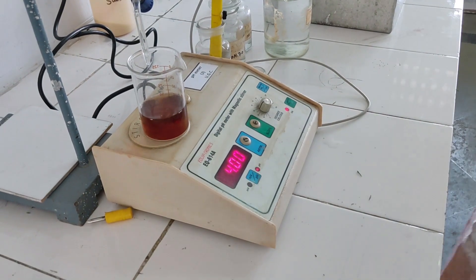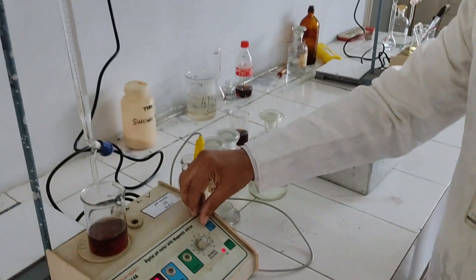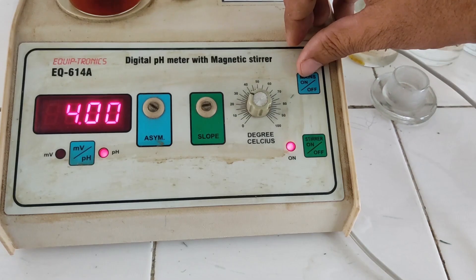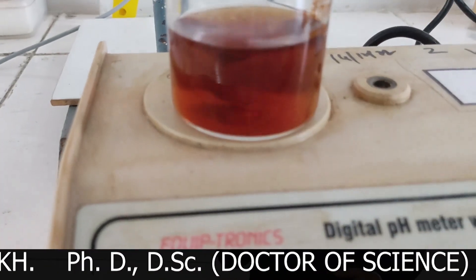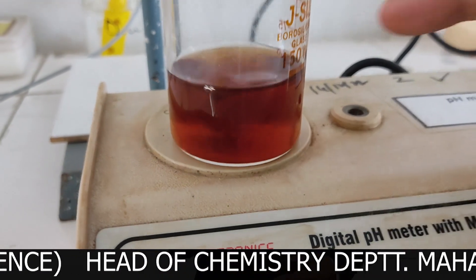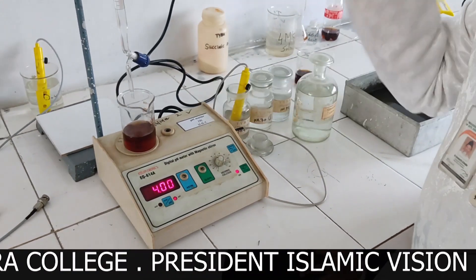Here I will show you — students always get confused. You have to put the switch on, that is power on, and put the mains on. For keeping the stirrer on, keep the stirrer on — the stirrer is moving. You have studied NMR nuclear magnetic resonance; how beautifully the magnetic stirrer is moving. The magnetic stirrer is magnetic, the platform is magnetic — what a beautiful circle it is making, getting the solution mixed.